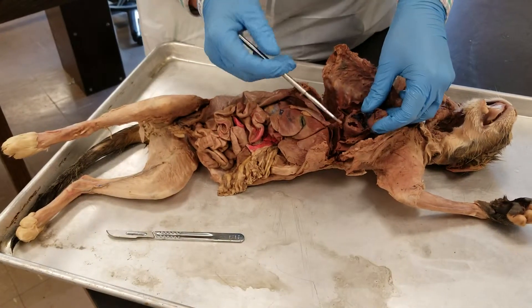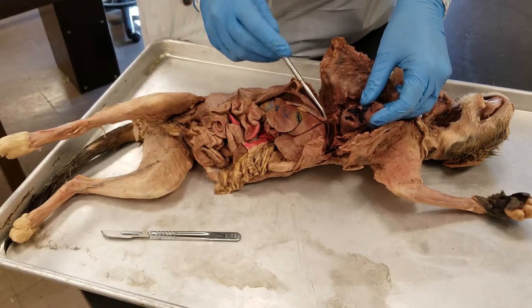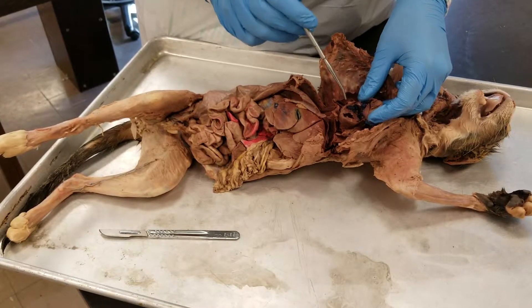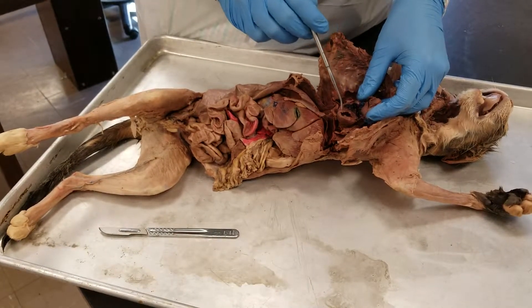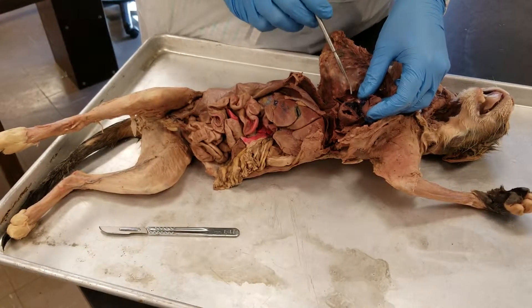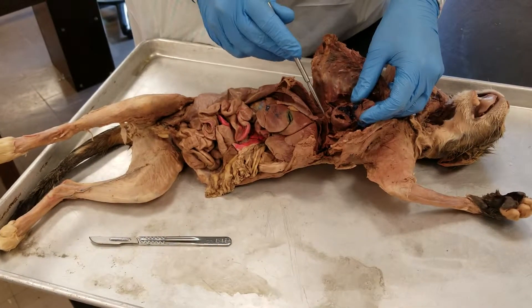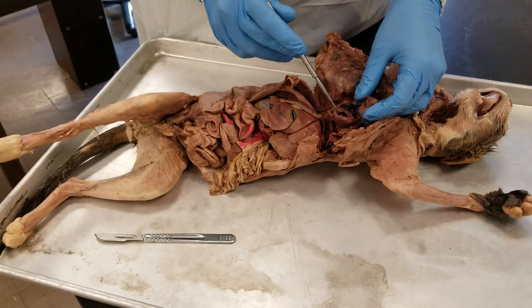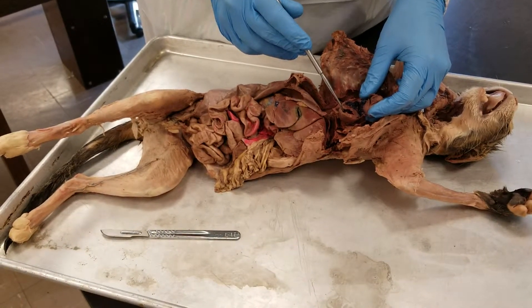Once we open it up, we can see the apex is down here. The interventricular septum is this middle piece. Over here we have the right ventricle, and over here we have the left ventricle.